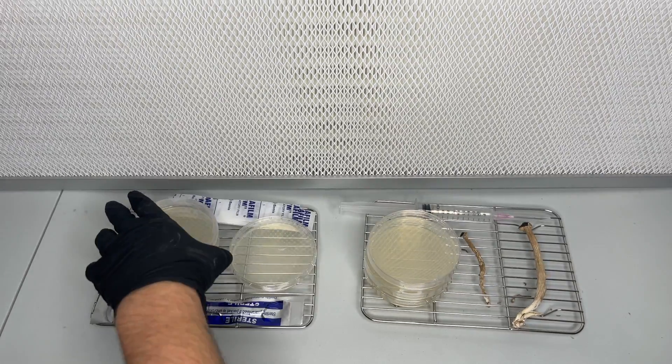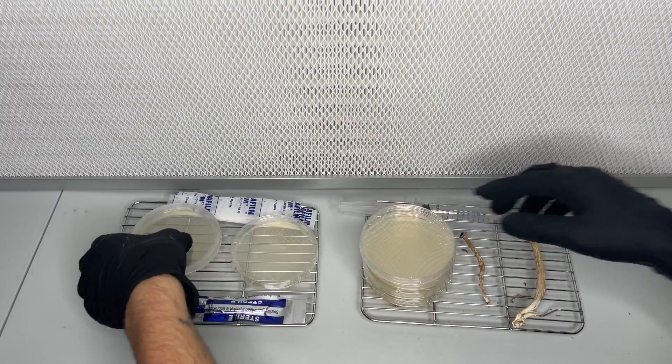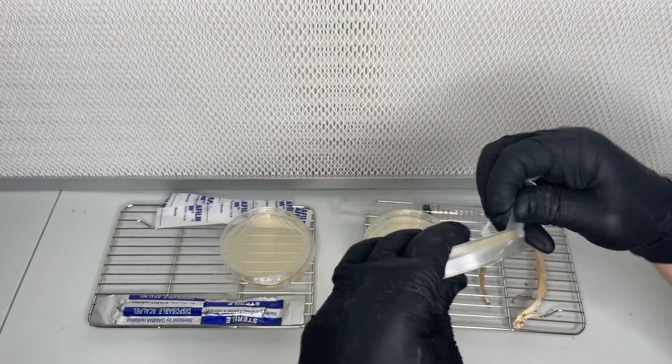To make sure everything is clean I wiped everything down with isopropyl alcohol and I wear gloves and a mask and I'm working in front of a laminar flow hood.